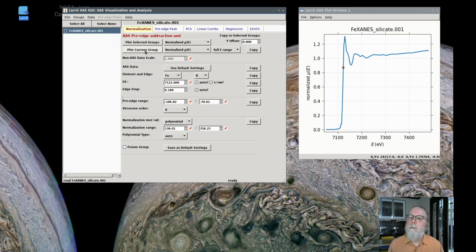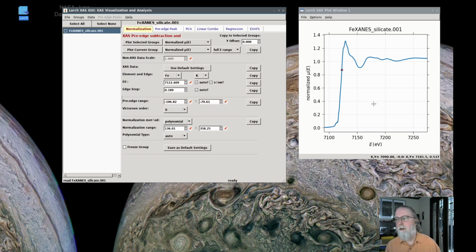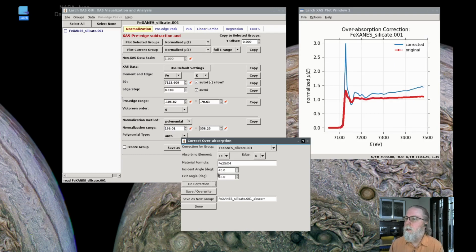And now if I plot this group, this looks pretty good actually. It isn't terribly over-absorbed, but it's slightly over-absorbed, in that the fluorescence coming out is absorbed, attenuated by the sample itself, and so that leads to the shortening of the absorption depth as the energy changes. So here we can make a correction for that by Correct Over-absorption. And to do this, you'll need to know a reasonable approximation of the stoichiometry of the sample. I'm going to say that this is Fe2SiO4. And it'll do the correction, and it doesn't need to be super accurate in the stoichiometry.